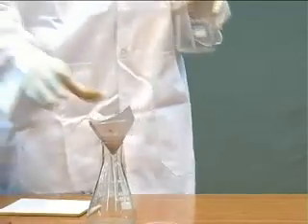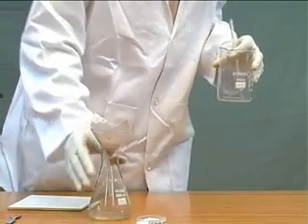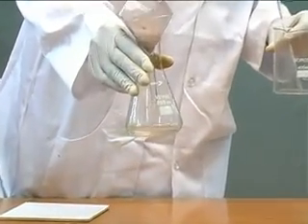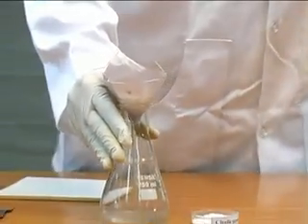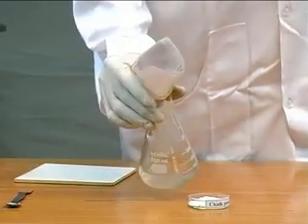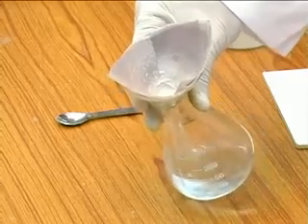The solid is retained by the paper while a clear solution gets collected in the flask. The solid can be removed from the filter paper after drying it.